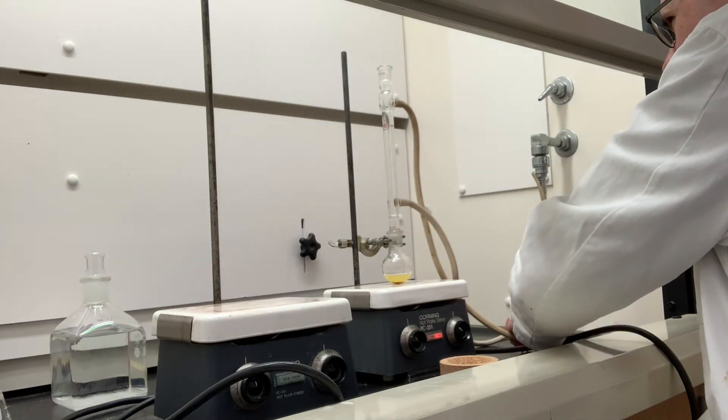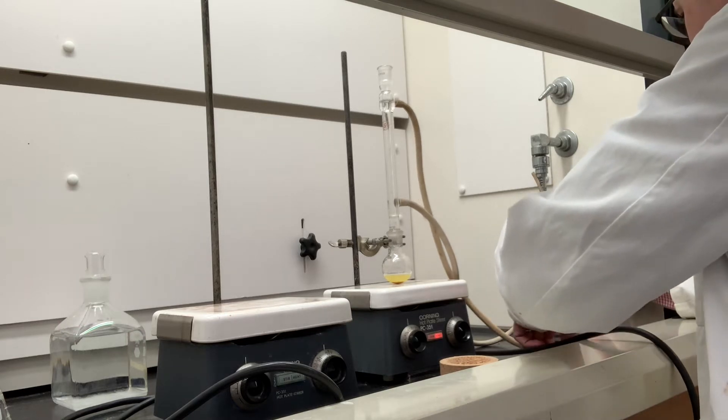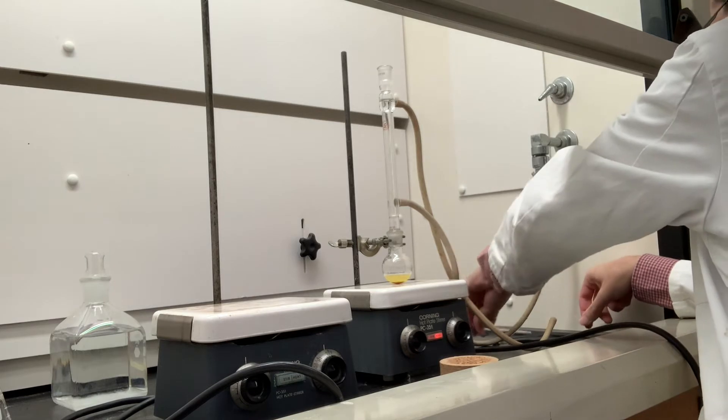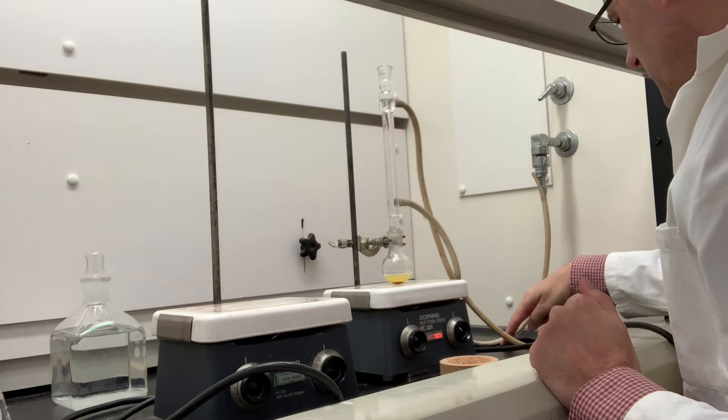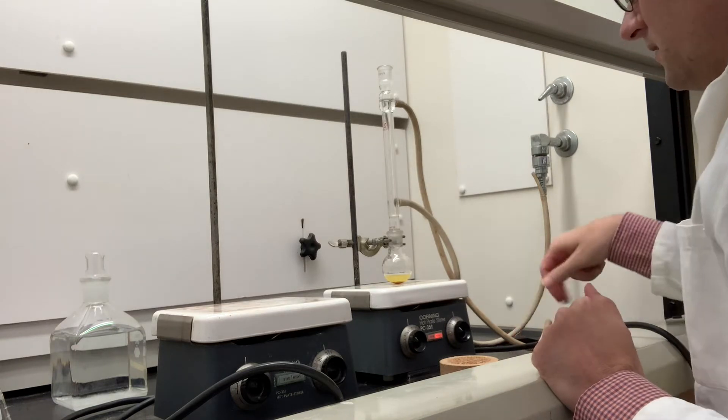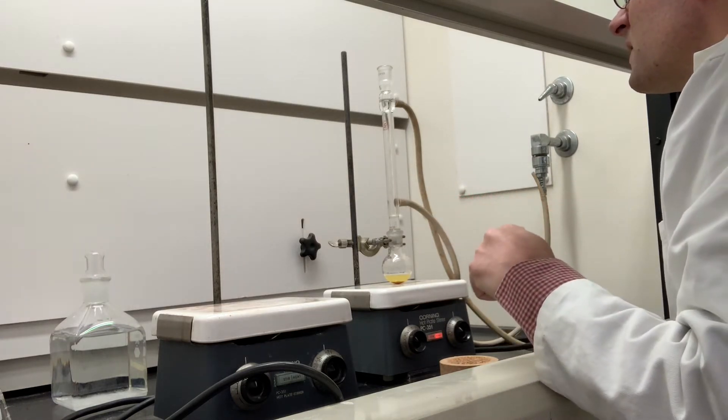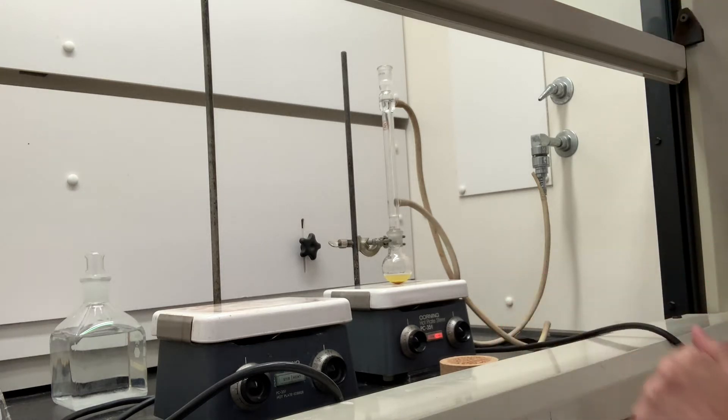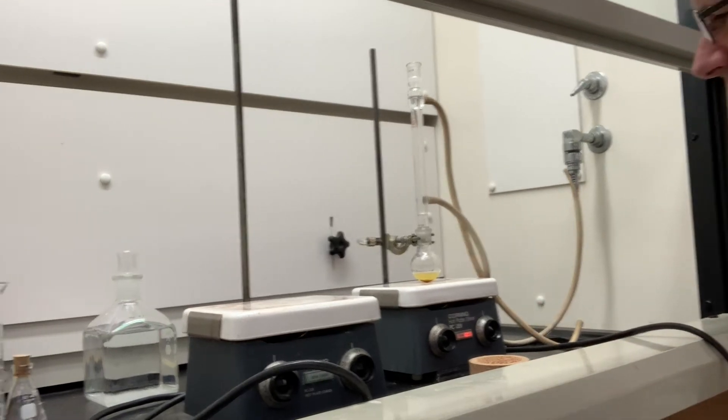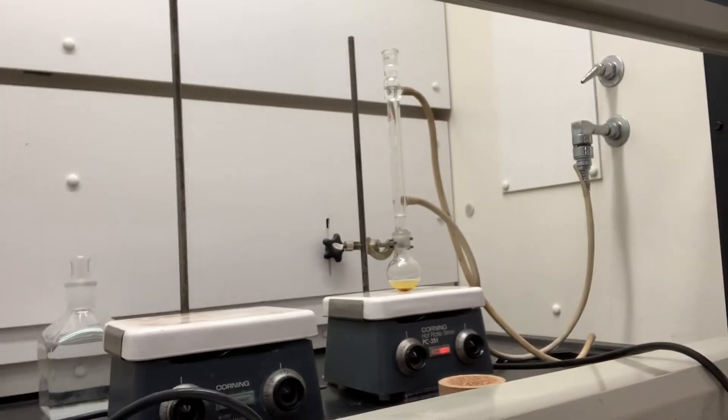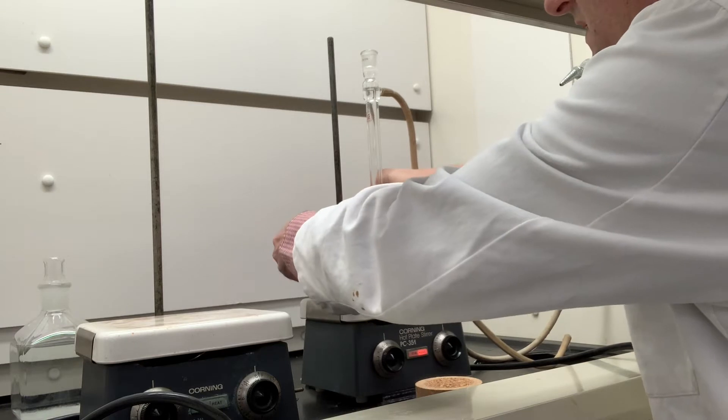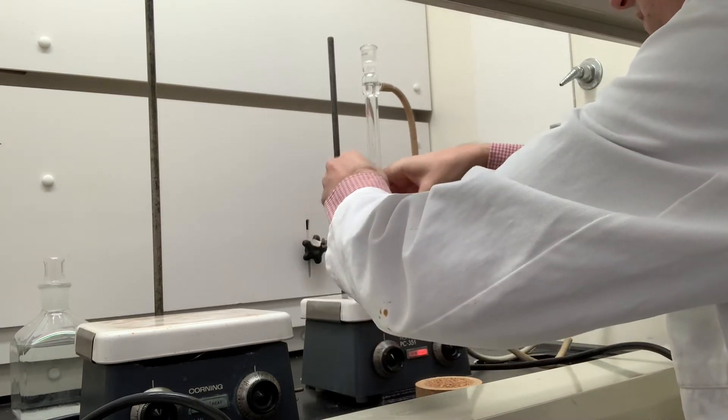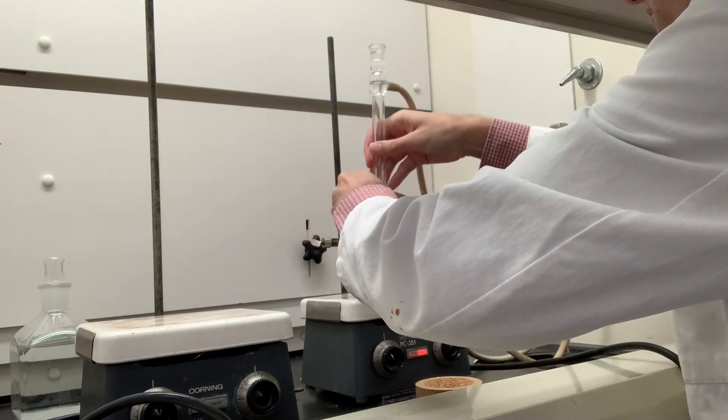We'll go ahead and let the boiling chip take care of the boiling. Maybe I'll just show the first five minutes of this reaction. It kind of turns a very dark color when the reaction proceeds.